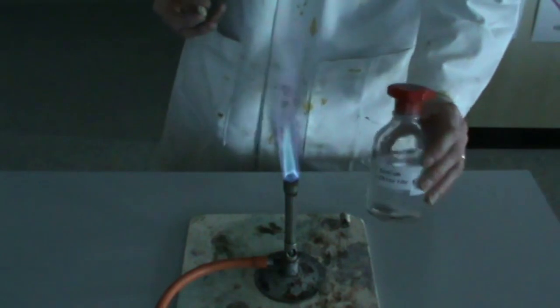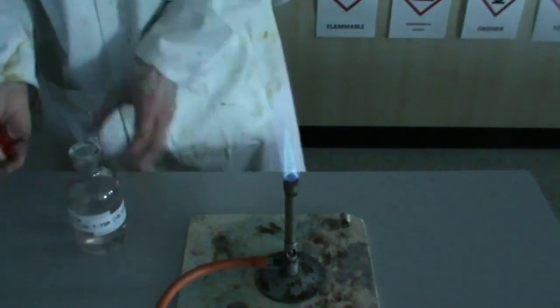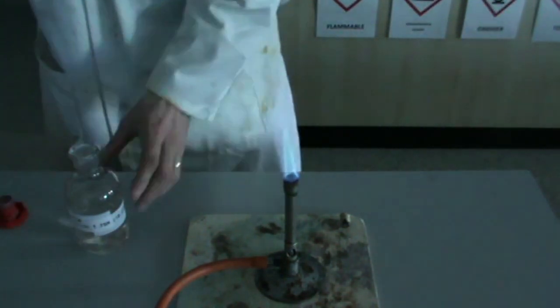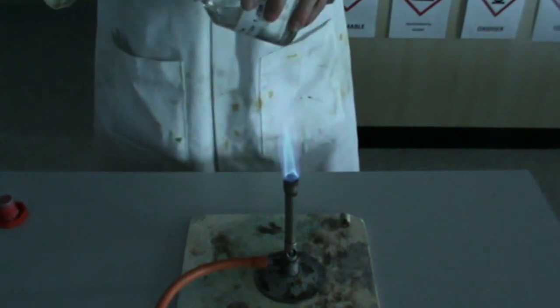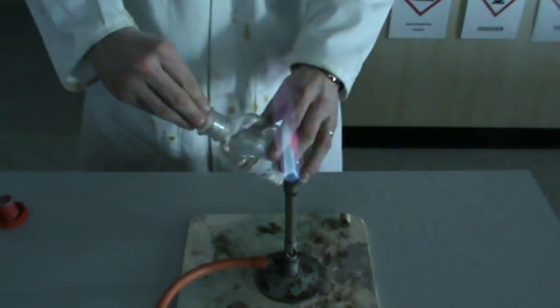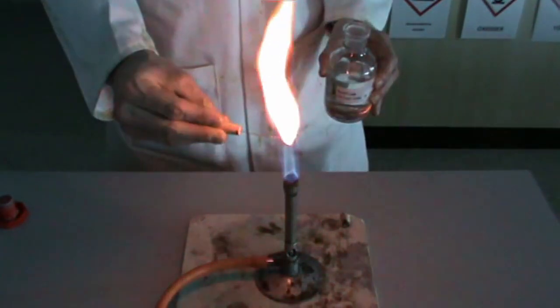First, we have sodium, in this case in the form of sodium chloride. The chloride plays no role in this flame test. Bright orange.